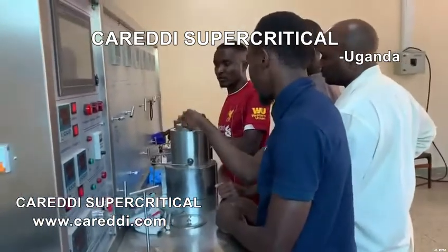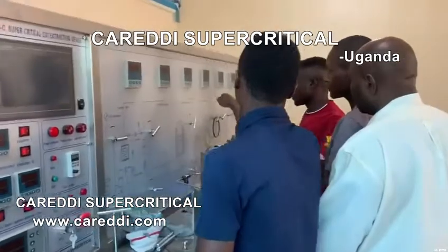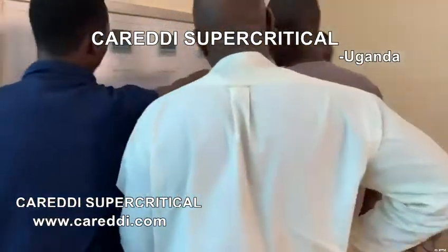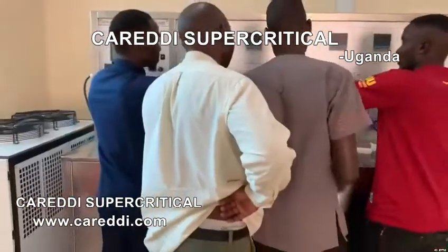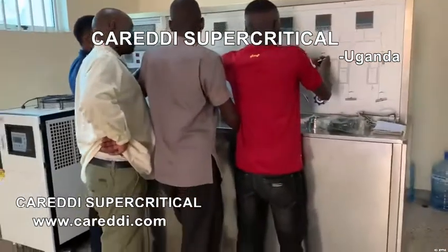For the video, we open the inlet for this one. What is the next? We have to know the inlet of the activity. Maybe you need to increase the inlet pressure further.